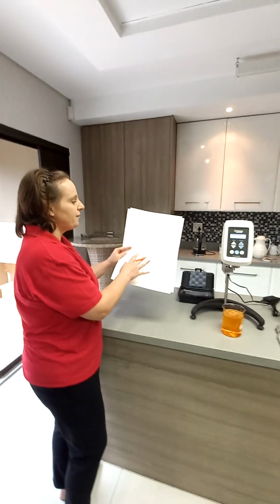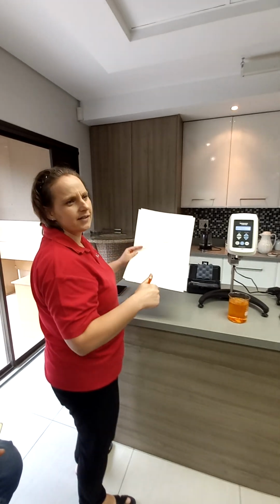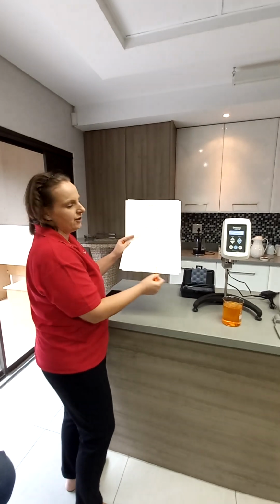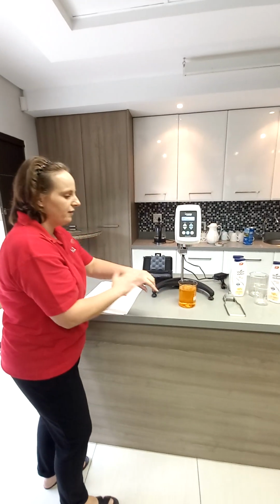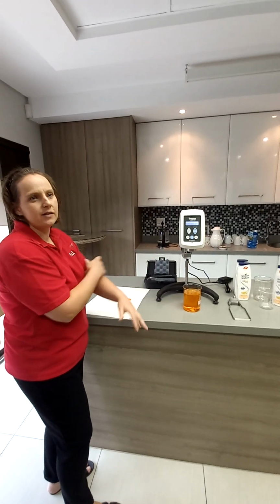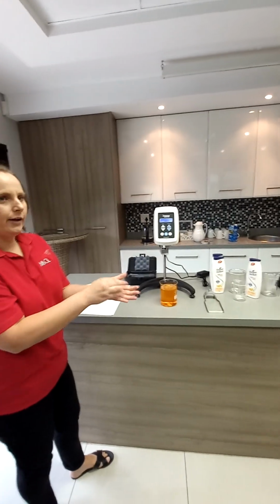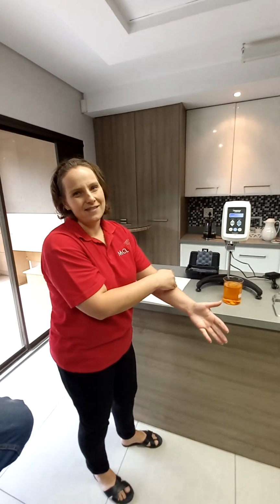You do get different non-Newtonian types, like pseudoplastic; you can read on the internet all the different ones. But most behave in this manner: viscosity drops with increase in shear speed. If you take cream or even your shampoo and put it on your hand, as you rub it, it thins out. Viscosity becomes less. Imagine you had a Newtonian shampoo. If you put it here, you're just going to move it along your arm because it doesn't thin out.